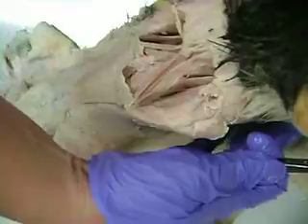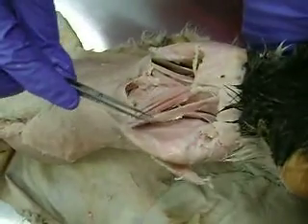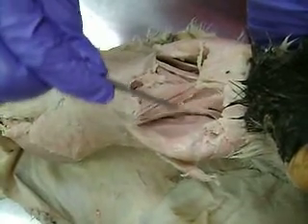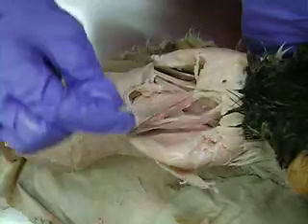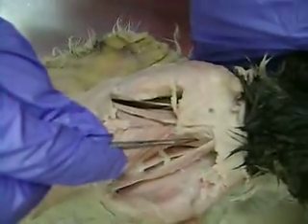So going up here between the shoulder blades, these would be the rhomboid minors. This one that comes up here sort of individually — this strong band here — is rhomboideus capitis. And then the flat one that lies underneath rhomboideus capitis, like right in here, would be splenius.